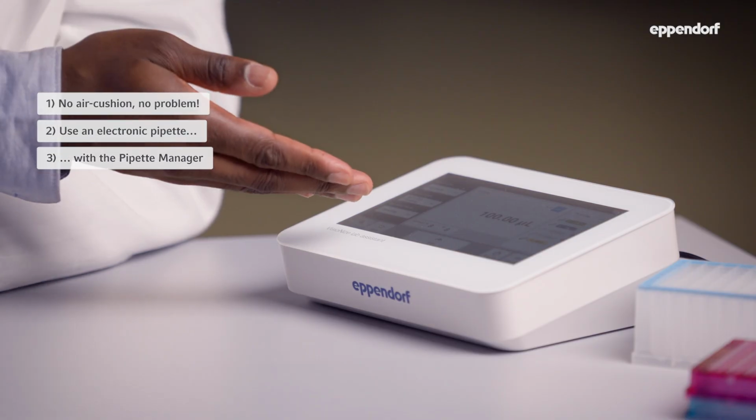If you upgrade to connected electronic pipettes, you don't even have to remember which settings are ideal, because the pipette manager can do all of that for you. Isn't that great?